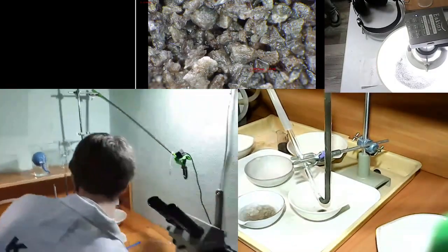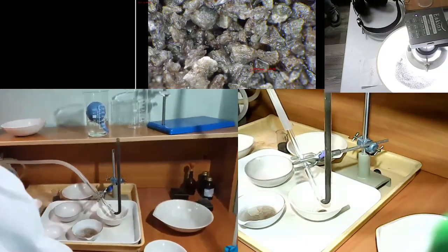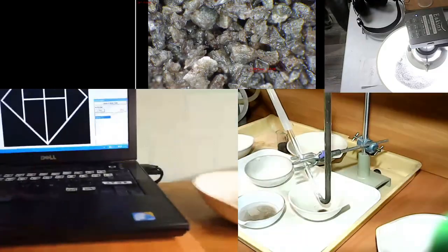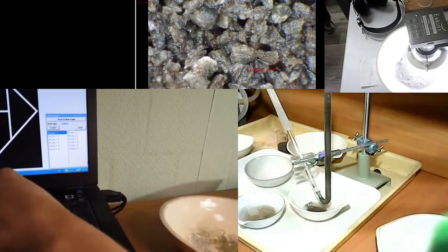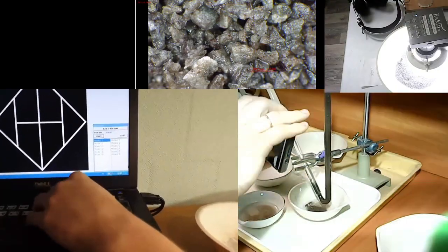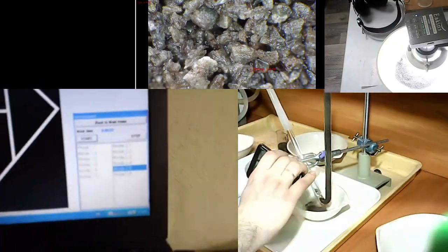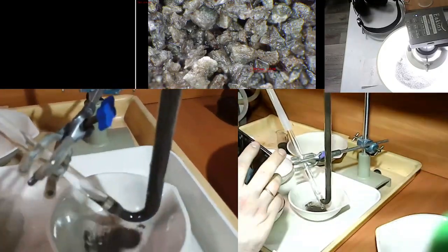And so there are regimes that can be worked out for a specific sample, and then loading and reloading from GST, and just repeat all the same regimes. So the first portion, I would say, of the sample would be the one to understand which is the best regime for processing of the sample, and how can we use automated approach to process all the residual amount of sample.